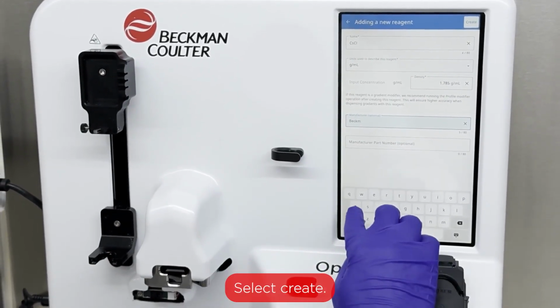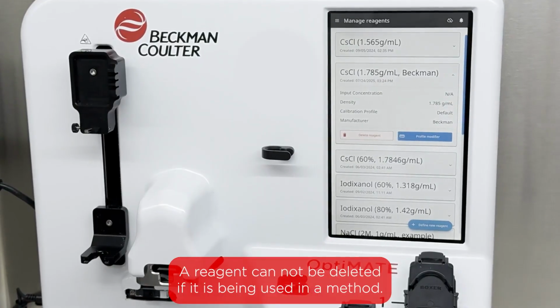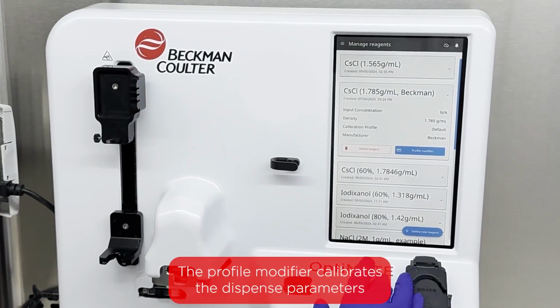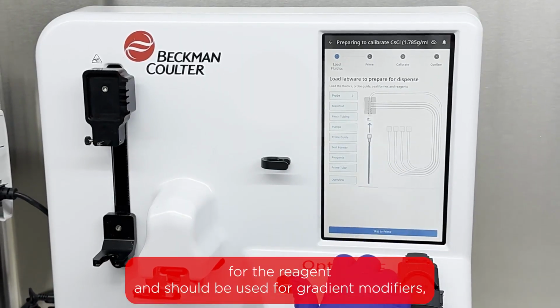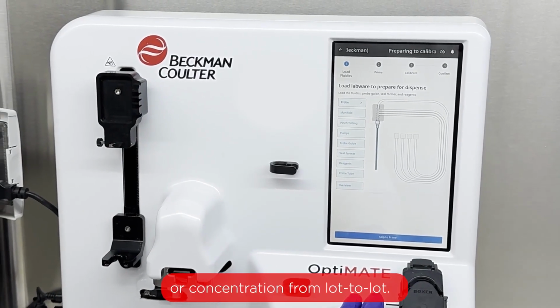Select Create. The reagent can now be managed from the Manage Reagents menu. A reagent cannot be deleted if it is being used in a method. It will need to be deleted from the method first. The Profile Modifier calibrates the dispense parameters for the reagent and should be used for gradient modifiers, especially if there is variability in density or concentration from lot to lot.